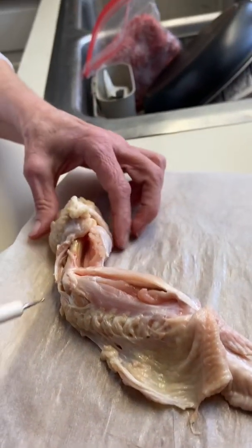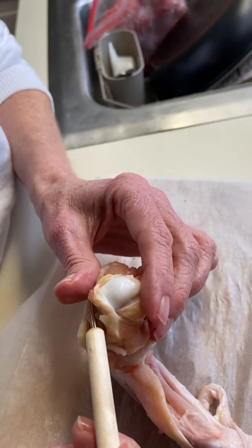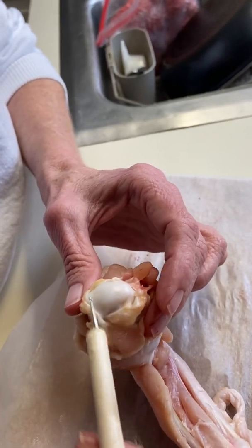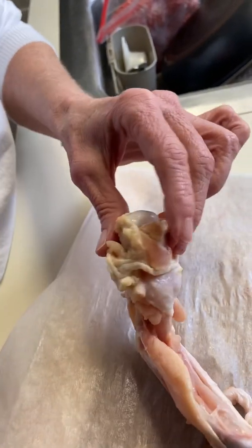Next, I will point out the hyaline cartilage, and the easiest way for me to get that, or the articular cartilage, one and the same, is to put here this very shiny piece here. And again, it's at this other joint space here, but this is very easy to visualize.